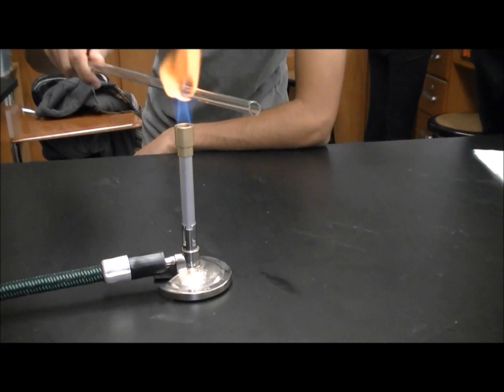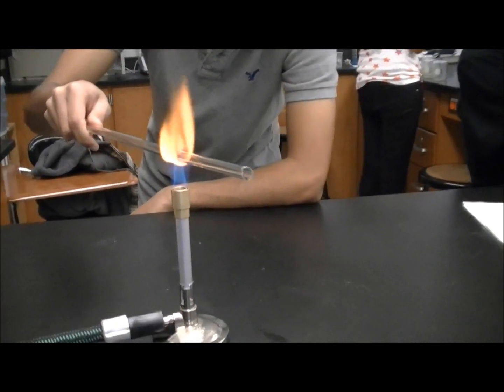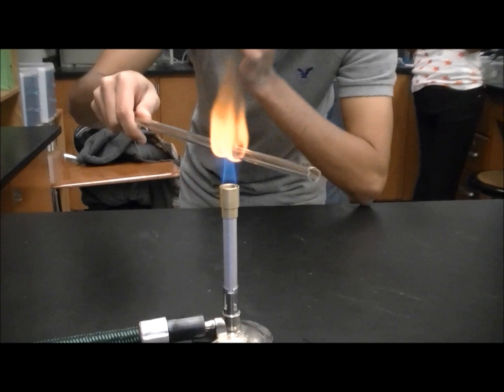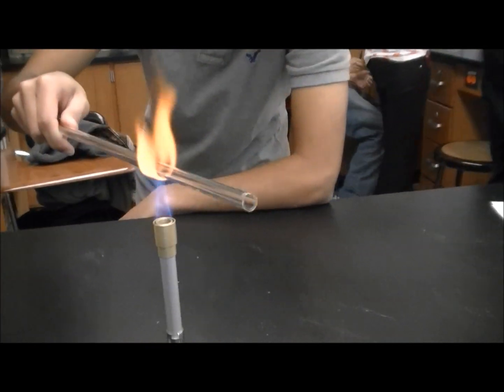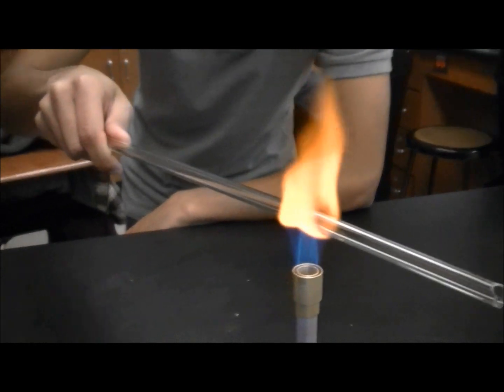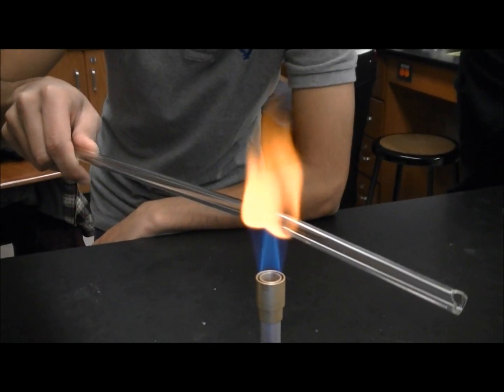I already have — I want to say I'm going to be putting more of this. It does look cool. I was just thinking about that video. I see bending!